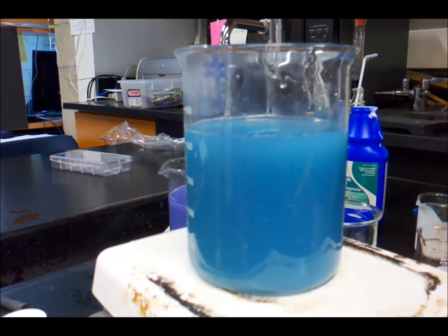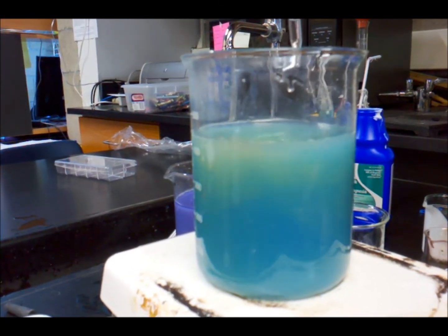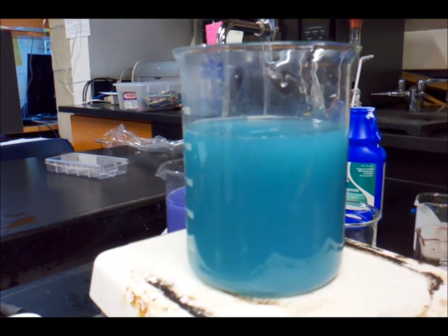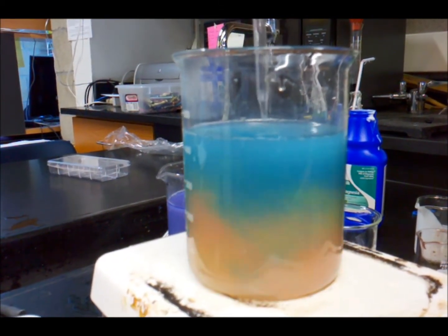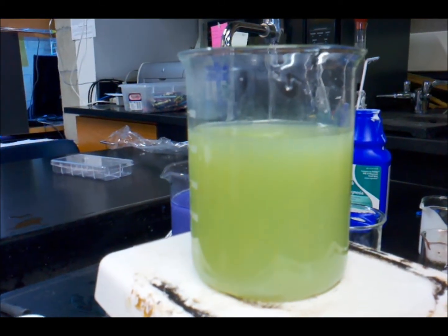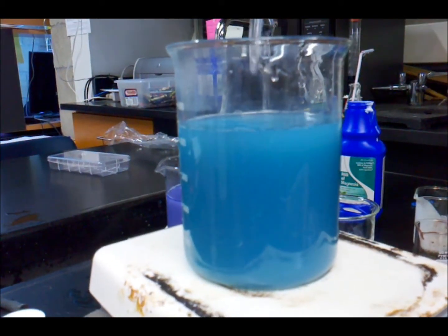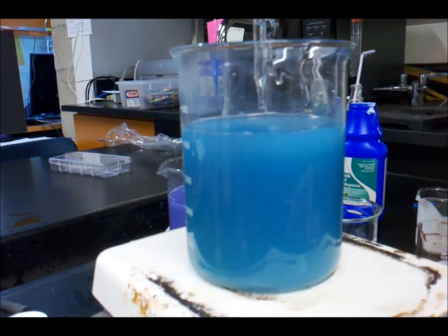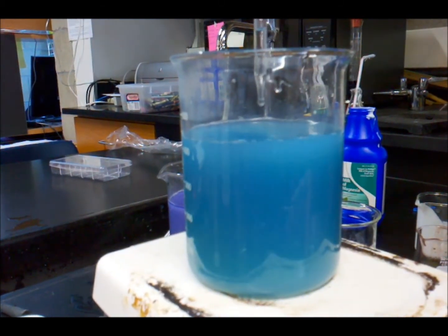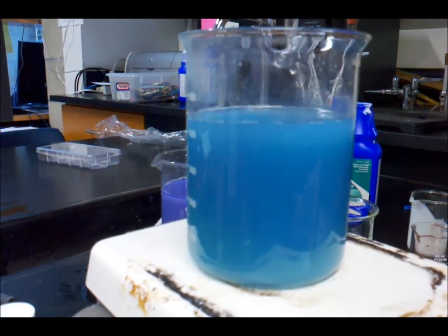Add it to the side next. It's going to change the top. Oh, there we go. It changes the entire thing if you add it to the side. Oh, just wait, just wait. Yeah, yeah. It's changing color too, like it's original. Just a drop in the bottom with the whole thing. Yeah.